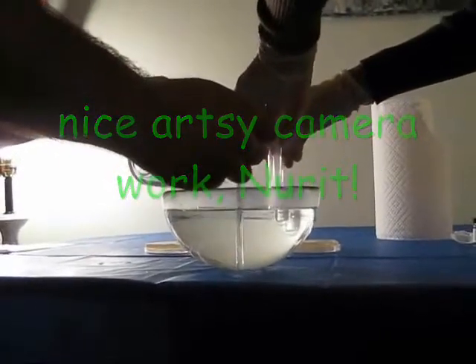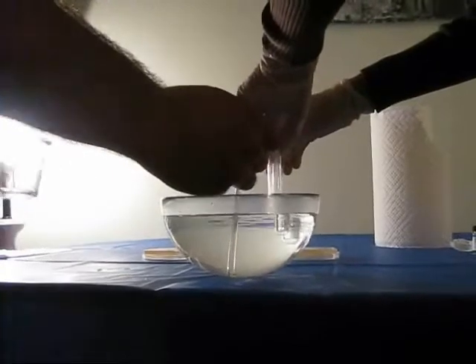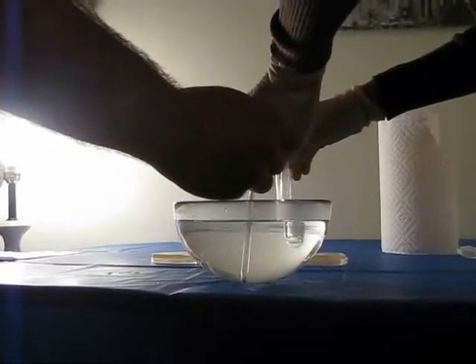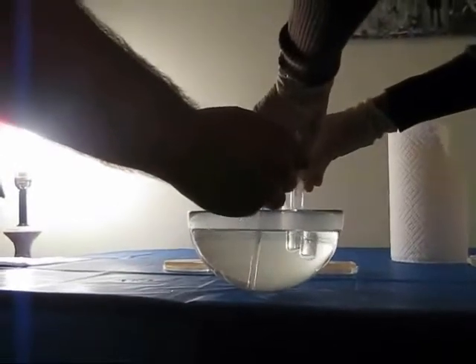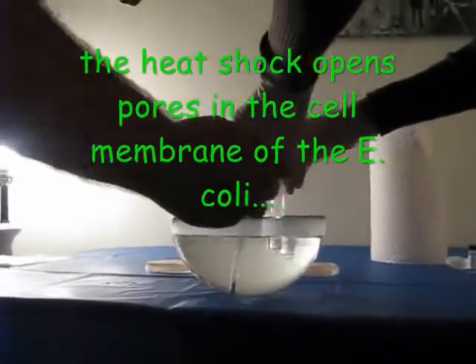We're going down. Oh no, you may have a hot pot. It's okay, we've got another 45 seconds to go. Do you want someone to fill that up? Can someone fill this with hot water from the kitchen? It's in the kitchen — quickly. Oh no, we're at 41 and a half!